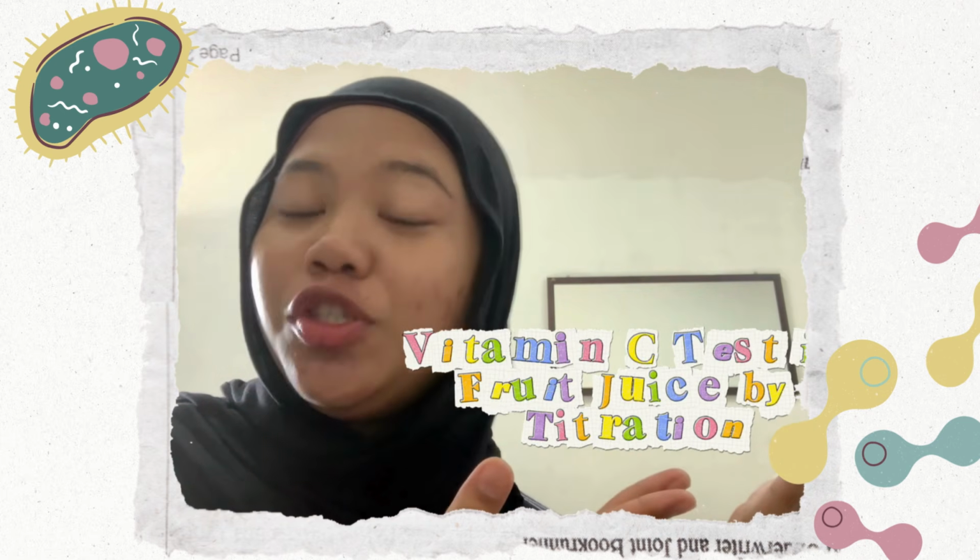Good day everyone. Today we will present our experiment entitled Vitamin C Test in Fruit Juice by Titration. The objectives of this experiment are to determine and compare the vitamin C content in different fruit juice samples using titration analysis.